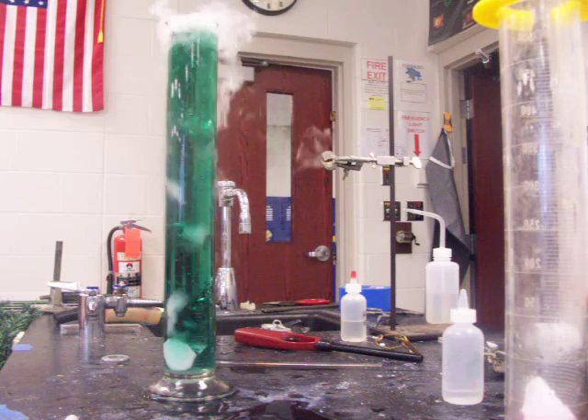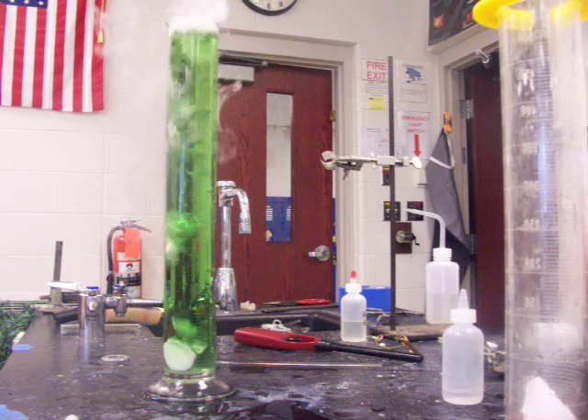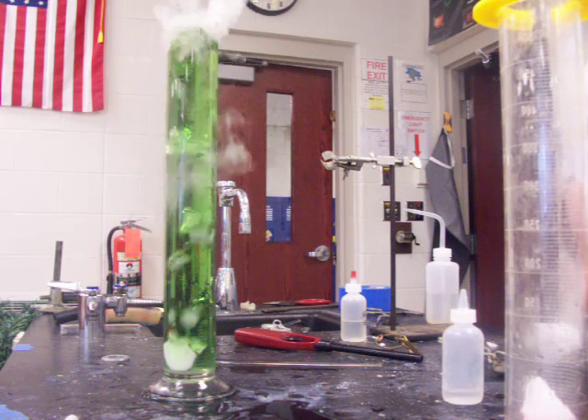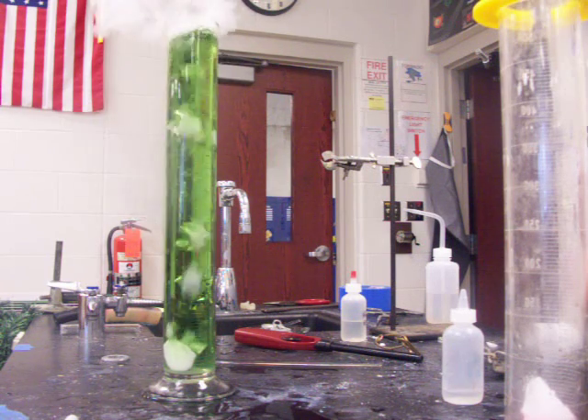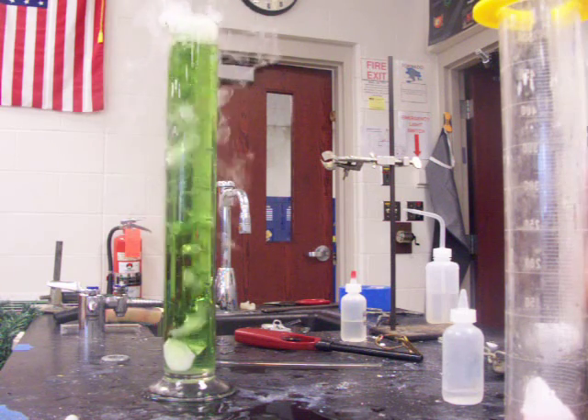If I what? It wouldn't pop the cork off — it's pressurized gas. That would be independent of the color change. Now having said that, it's got a little spout here, and so some of the gas would escape, but it would probably eventually pop the cork off.